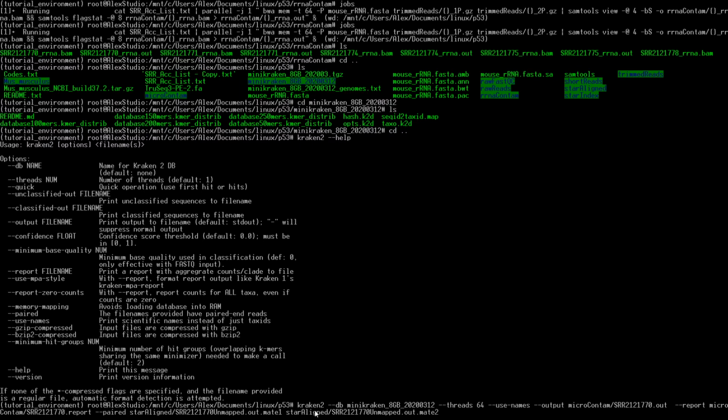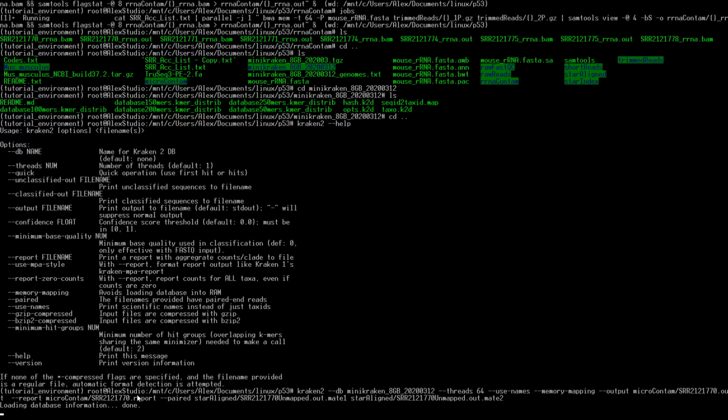So if we run this, what it's going to do is it's going to load the database into RAM, and then after it's loaded into RAM, it's going to go through and start mapping. But if we want to skip the loading into RAM part, and they recommend it for when you have a lot of samples that you're looking at, you can use --memory-mapping. So that'll avoid loading the database into RAM. Instead it's going to look at the database in storage, and it should hopefully run a little bit faster. Run it right off the top, loading database information, and then it stops the loading part. We'll instead go through and start running that in memory itself, or in the hard drive itself.